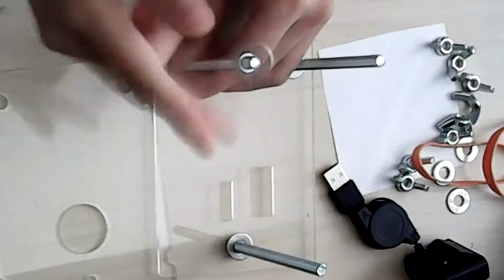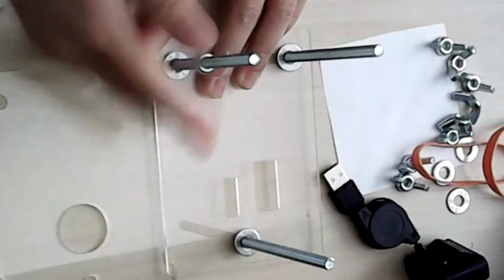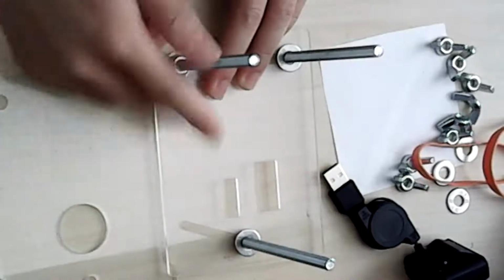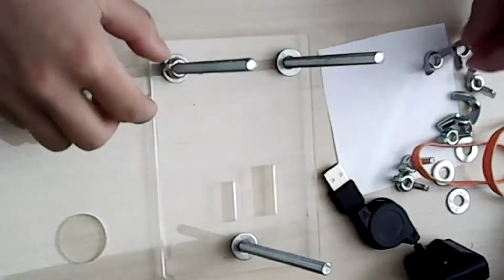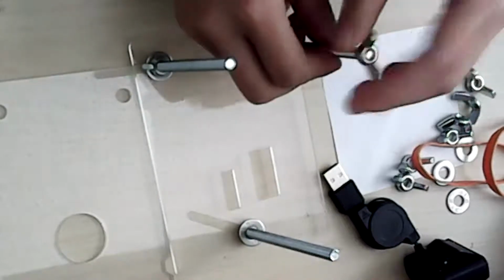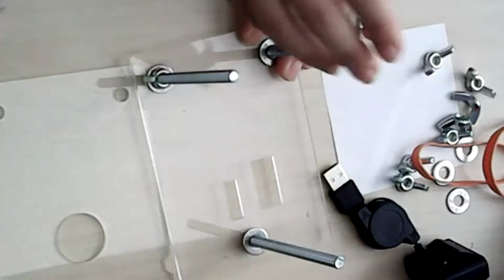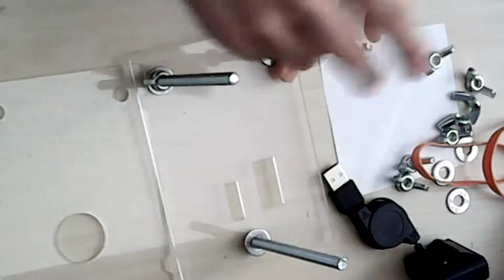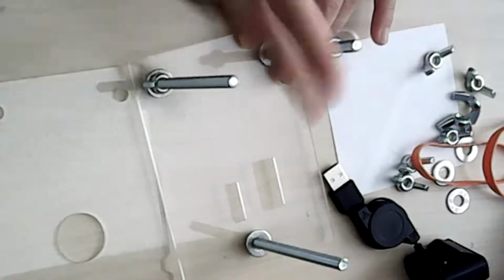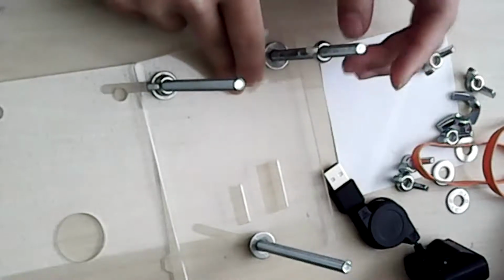While I do that, Jeanette mentioned that this is a dissecting scope. You may already be aware, but for folks who are not, there are 2 general types of microscopes: the compound light microscope and the dissecting scope. The compound light is where the light source and the camera are on different sides. So it's really good for seeing really thin specimens, and essentially the light has to pass through the specimen to get to the camera. So it's good for thin specimens and cross sections.